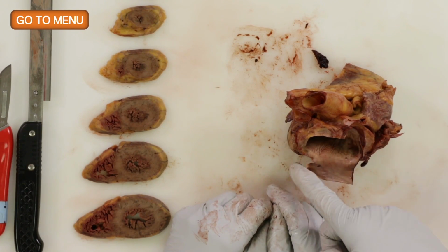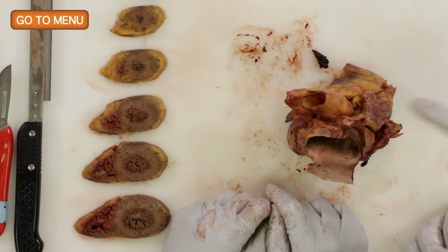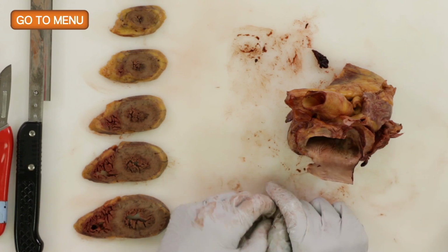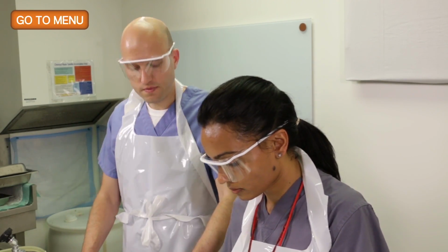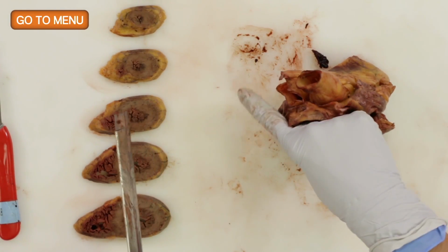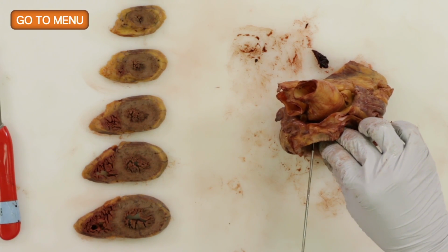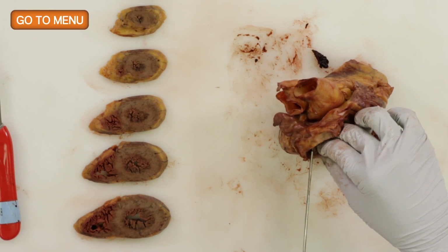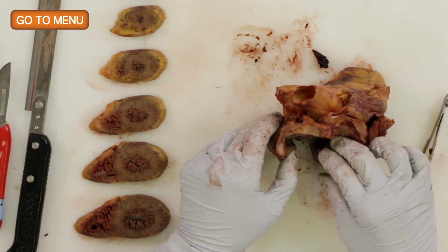Either way, I mean, you could do it over there. My problem with doing it along the lateral border is that it'll make the next cut a little bit too close, I think. So that's why I like to give it a little bit more room, halfway right in between. Yeah. Let's use the knife. Thick. Yeah, we continue to cut through the papillaries and the chordae.